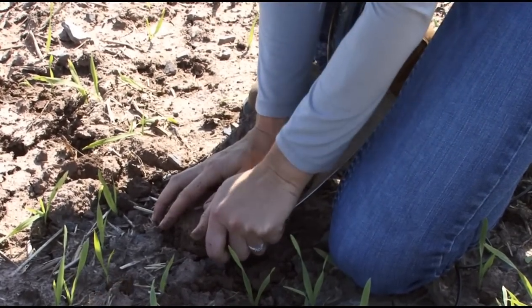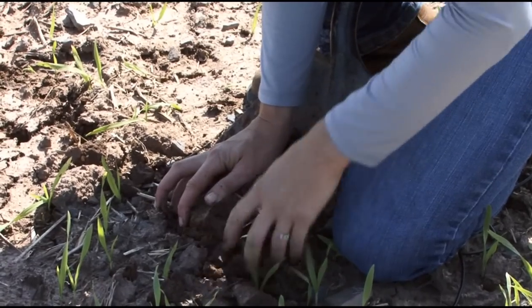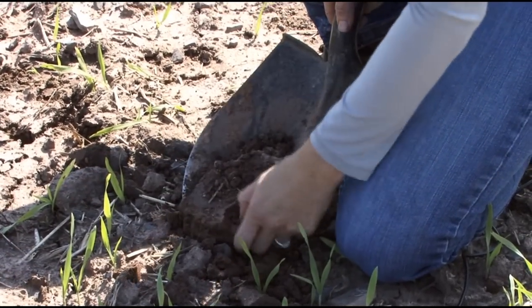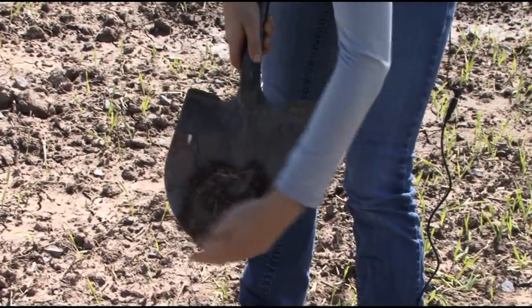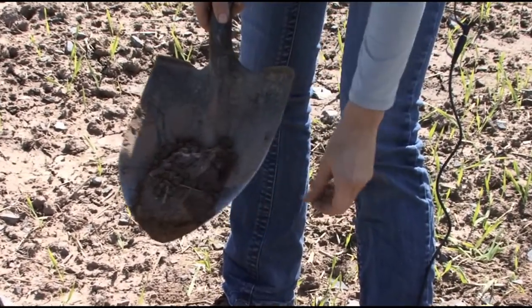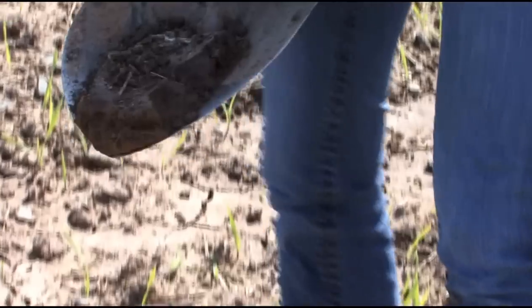So if you can just take off the sides. That sample's a little better. There's your cross section — it's more uniform with depth, which is what you want. And that sample will give you just as good results as a probe will.